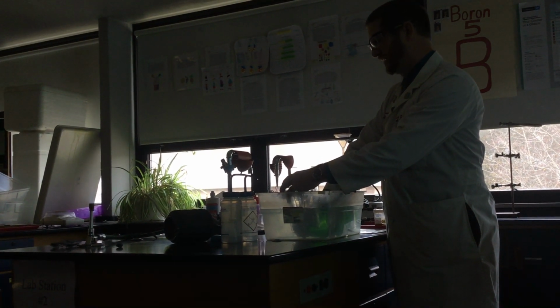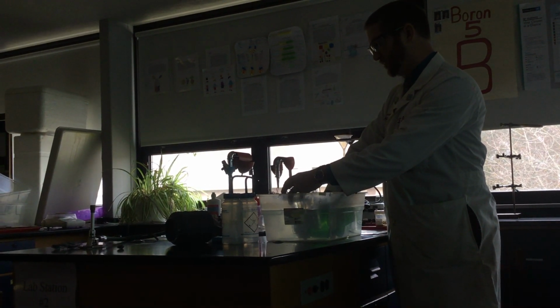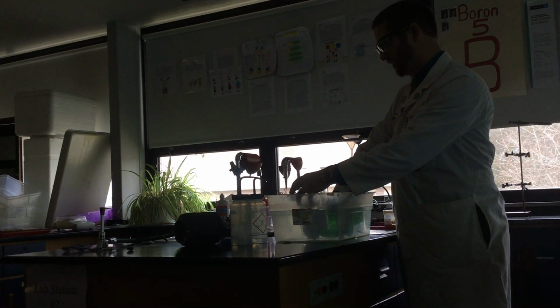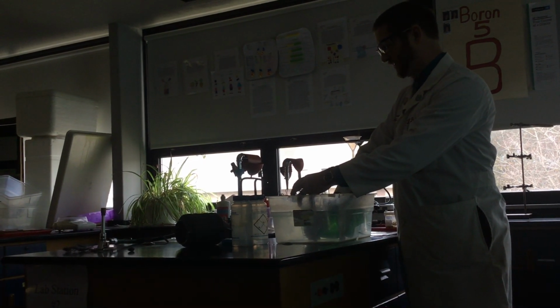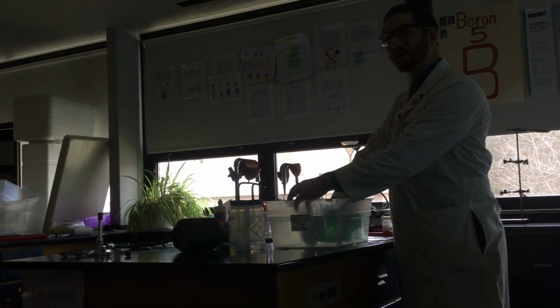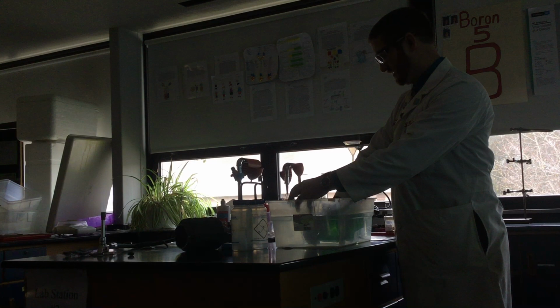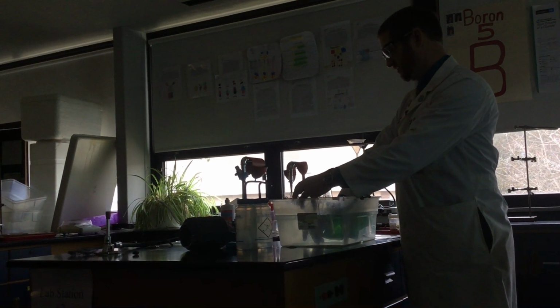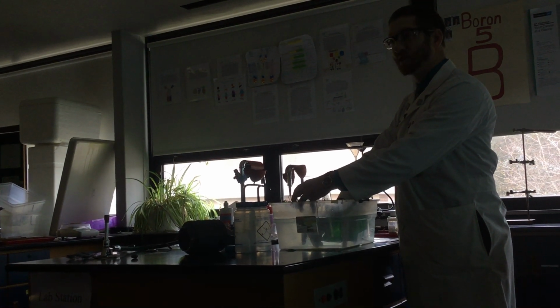So depending on the kinetics, depending on the rate law, which we'll learn about this unit, if it would happen to be first order as far as oxygen goes, basically right now I'm increasing the concentration of oxygen by 5 times. Like right now in the air it's about 20% oxygen, whereas inside this flask it'll be basically 100% oxygen. So if it is truly a first order rate law, that should basically quintuple the rate of the reaction.